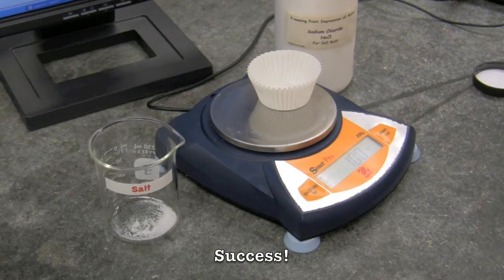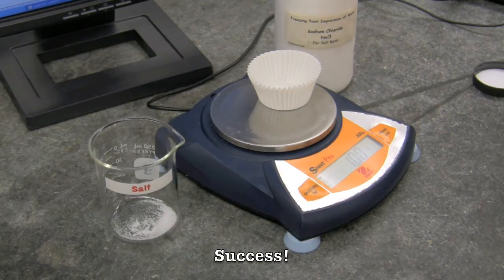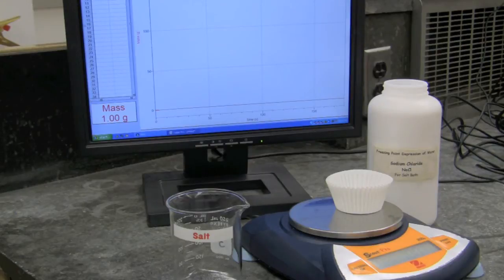And success. 1.00, the student has measured exactly one gram of salt without visual aid.